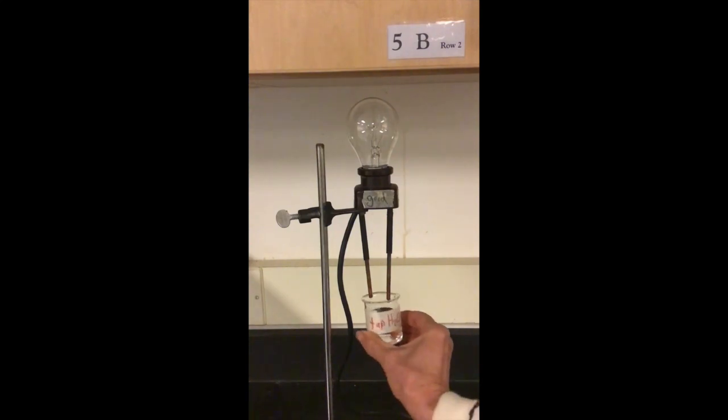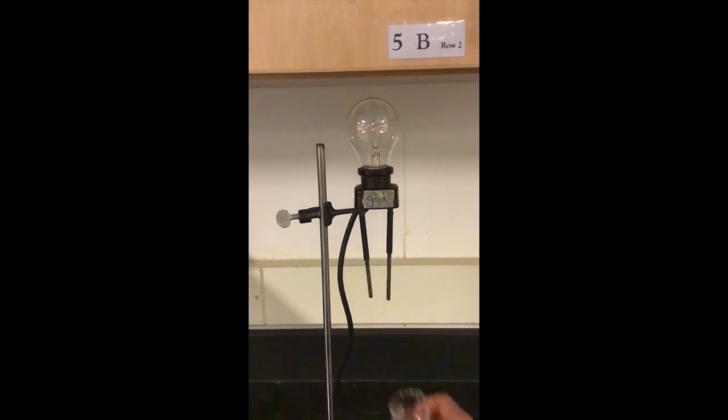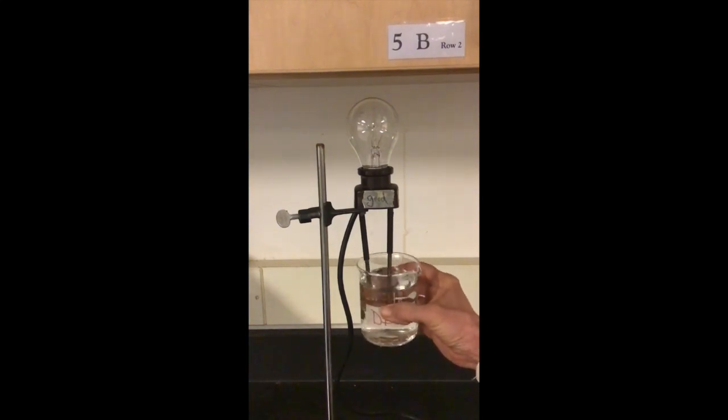Next one we have is tap water. If I swirl my tap water, we can see the filament is lighting up slightly. Between each solution, it's very important that you always clean the probes with deionized water to make sure there's not any remaining ions left on those probes.